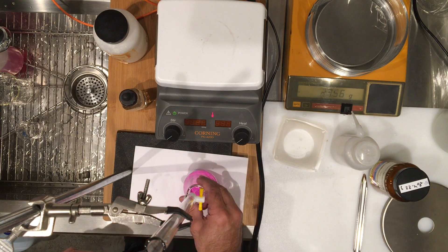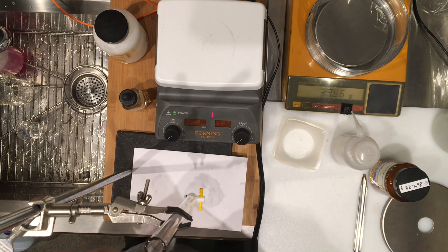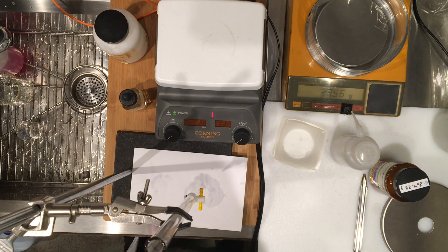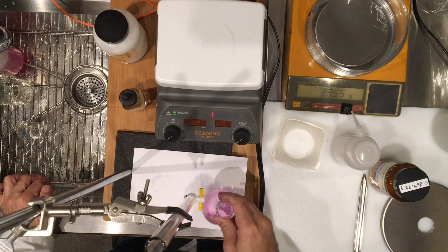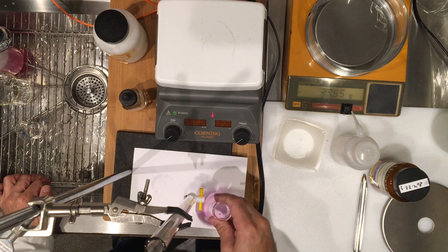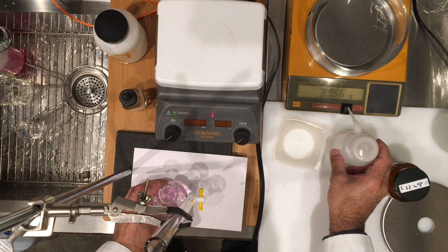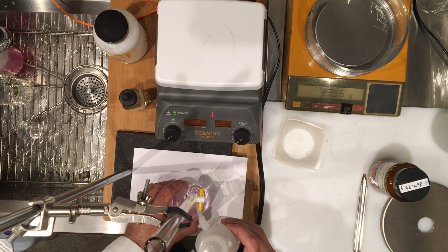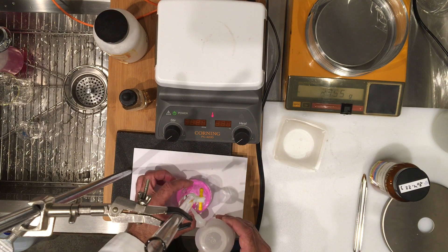That is it. I'm going to wait again to make sure — if the color goes away, then I know I still have a little bit of KHP left. I'll check it visually, and it looks like there's a tiny, like one last crystal of KHP left, which may make the color go away or it may not. But there's actually a hanging drop here, so I'm going to go ahead and remove that — that's always like a spare drop for you, which already accounts toward the volume.